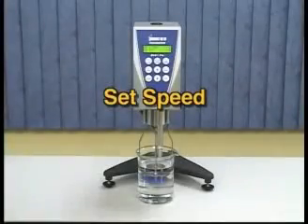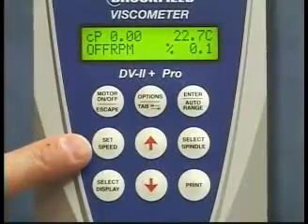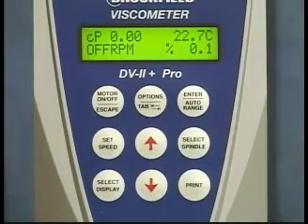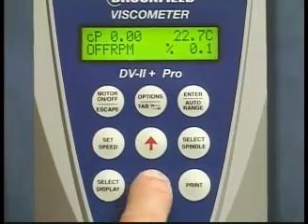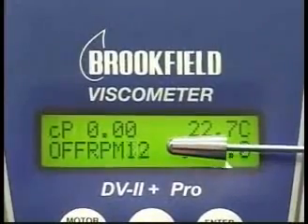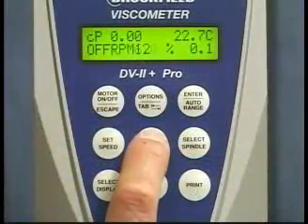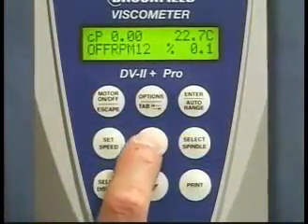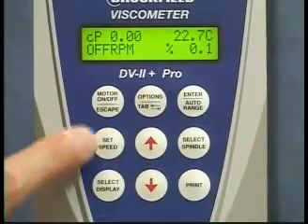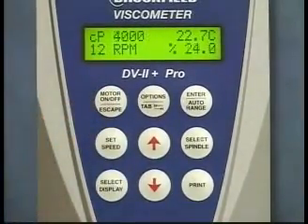Set speed. The set speed key is used to select from the 54 available speeds on the DV2 Plus Pro. With the motor off, use the up/down arrow keys to select a speed, then press the set speed key. When the motor is turned on, your selected speed will be displayed and run.